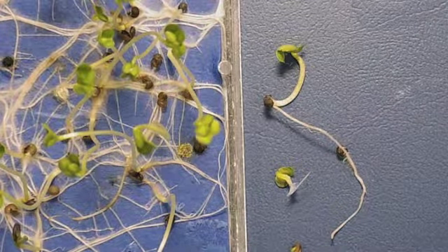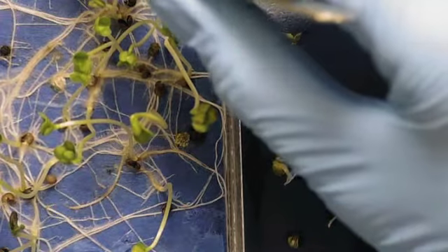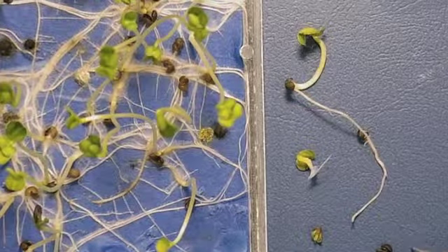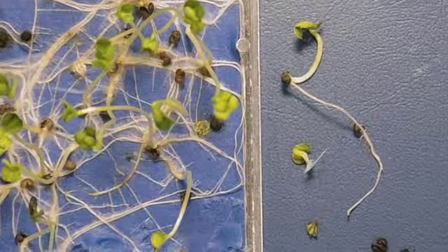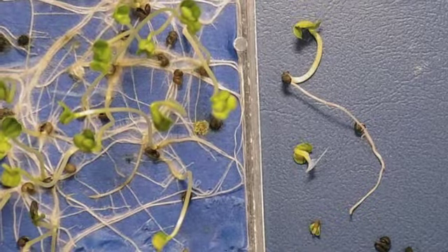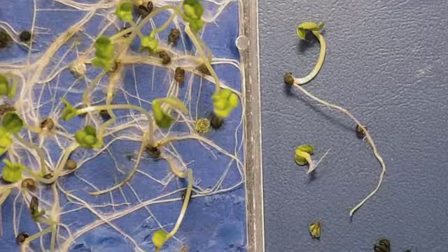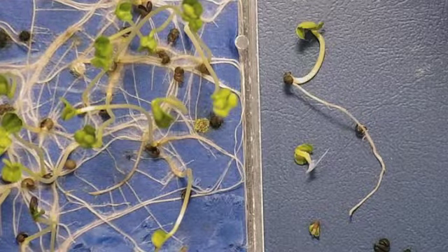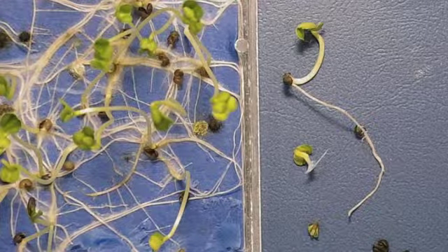Now the dead seed is quite moldy and very soft, which indicates that we have a problem with moisture, and this seed has had high moisture from the very beginning when it was harvested, and that moisture has allowed the seed to decay rapidly. It's very, very important to have correct moisture at the time of storage, otherwise the storage ability of the seed is compromised very quickly. And there's more dead seed actually than there is abnormal, so we know that this particular sample is starting to drop off because of moisture issues.